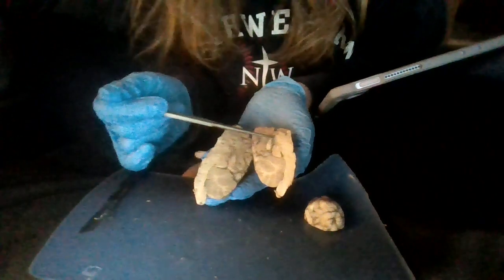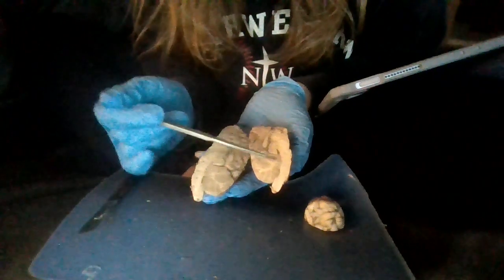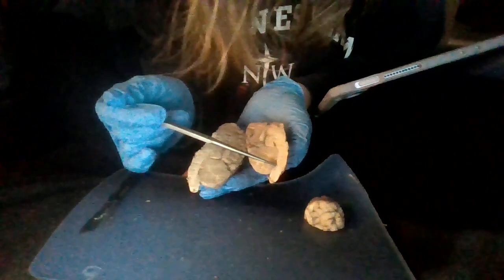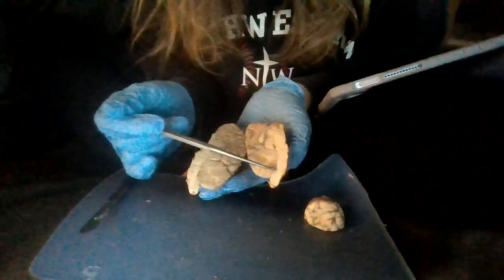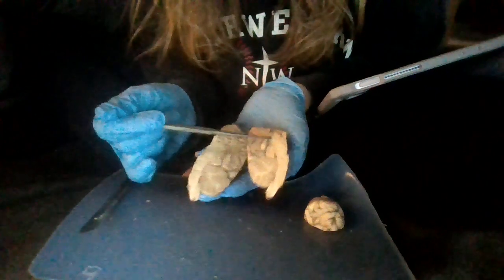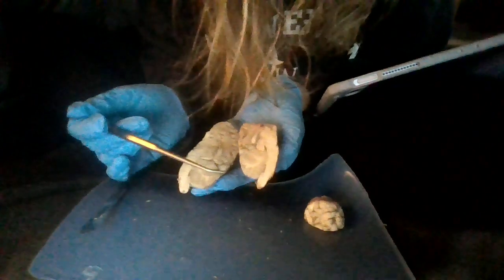And then we have our third ventricle, which is going to be right there on top of it, kind of that groove you can see. And if you look at our fourth ventricle, it also is kind of like that groove, if I point out the right thing, that is. The fourth ventricle, you can see the groove there. And for the third, you can also kind of see the groove there. And you kind of move it when you prod it.